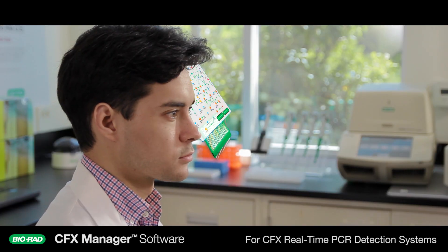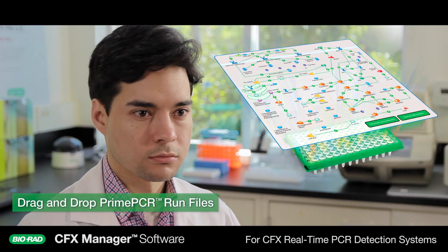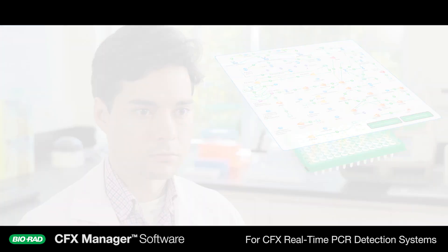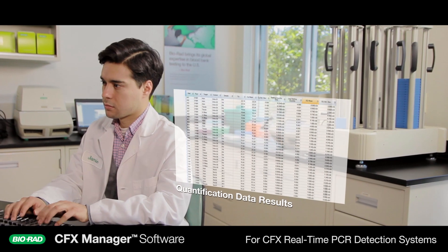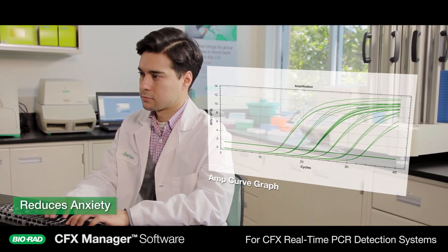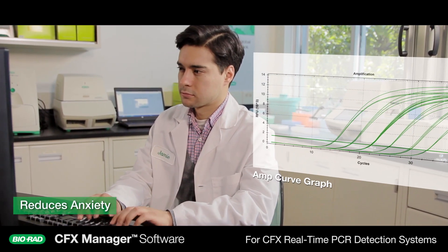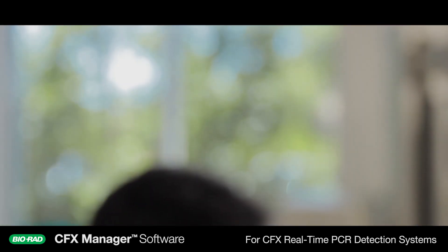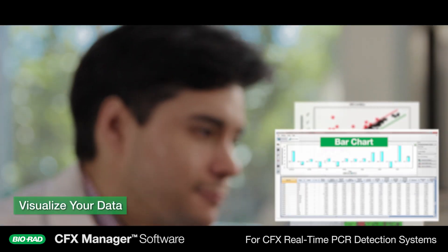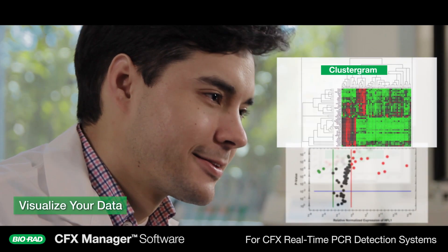First, it targets the source of your qPCR pain with an easy three-step experiment setup. Next, powerful quality controls and standardized calculations stabilize lingering anxiety. Finally, rich analytical tools bring your data back into focus, restoring your confidence.